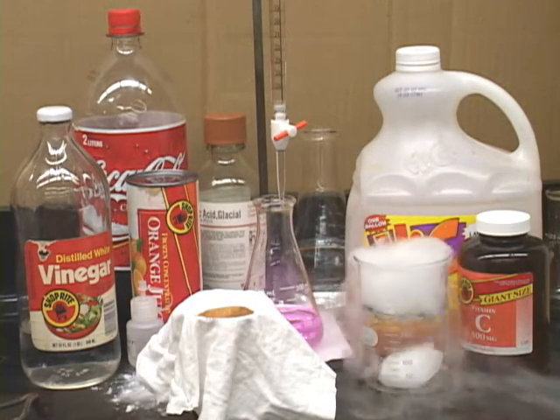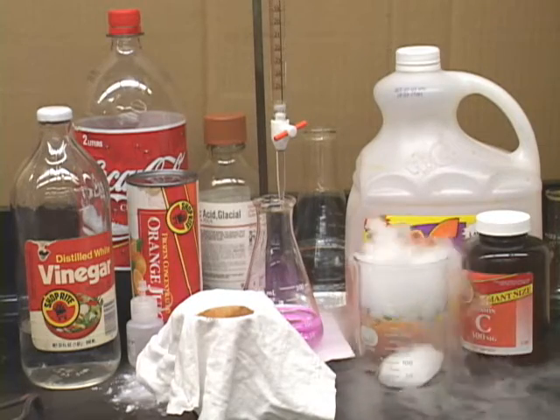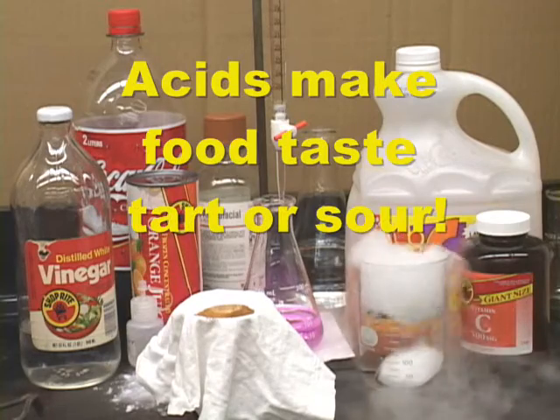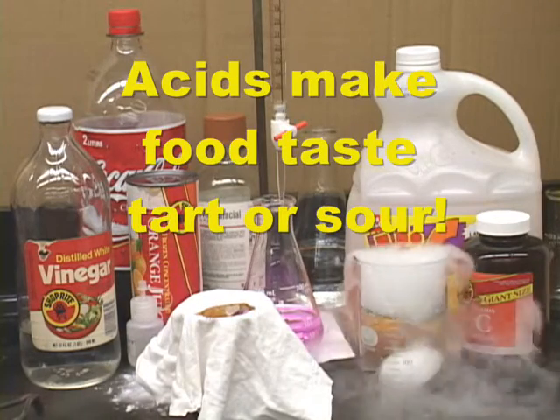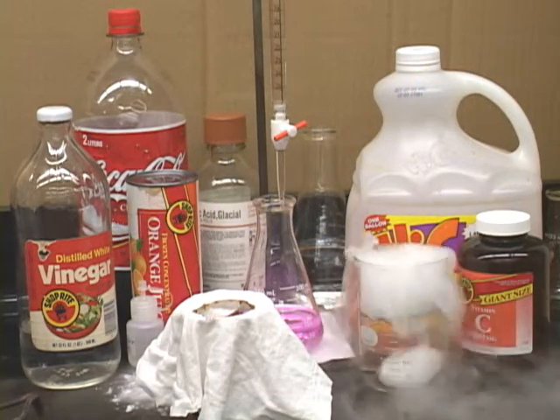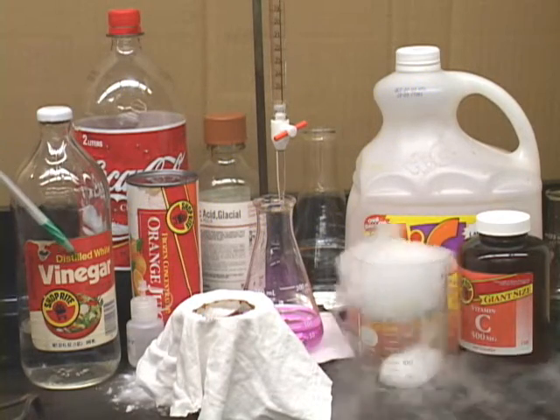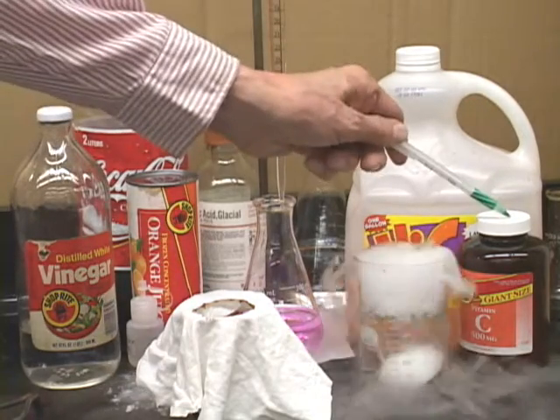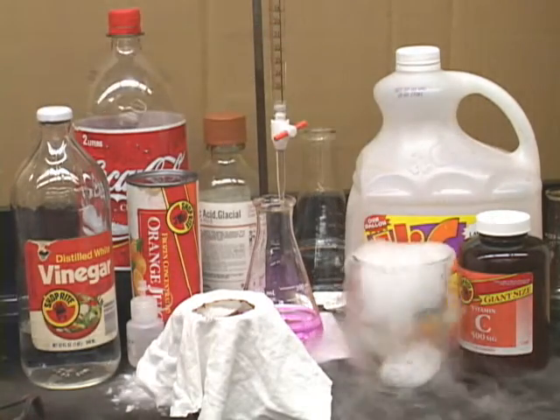There are acids in the food we eat and drink. They surprise our senses with a sour or tart taste. Now, today we will be analyzing two well-known acids. We will analyze vinegar to determine its acetic acid content and vitamin C for its ascorbic acid content.